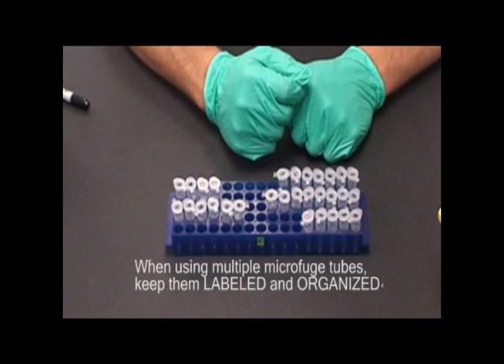If unsure how to complete this, review the video, Serial Dilutions. The dilution tubes should all be labeled with the contents and the dilution and kept in an organized fashion, as shown here.